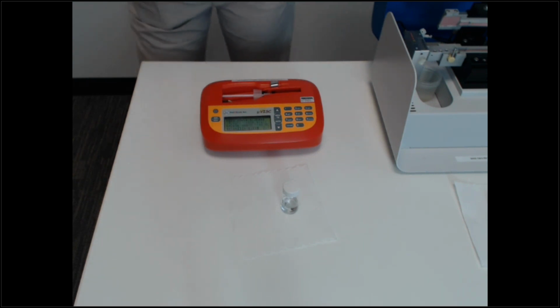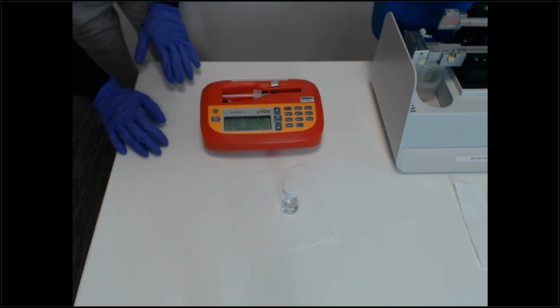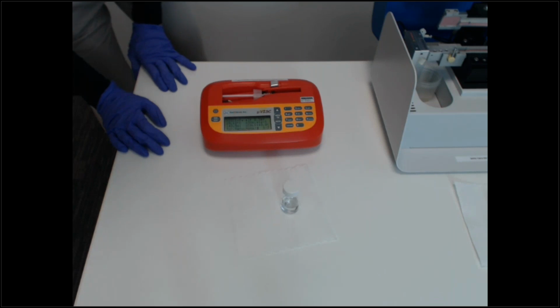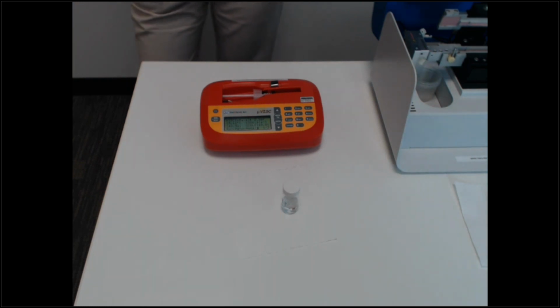So we got an R² value of 1, which is one of our control methods to make sure it's a good measurement. And we got a viscosity of 2.3, which is, again, what I would expect from 2.2 to 2.3 with this IPA and at this room temperature. So as you can see, that took a little bit more than 100 microliters, and that's because it had to prime on auto mode and then run it. The subsequent runs would take less than 100 microliters, but that always is something to keep in mind with Microvis.